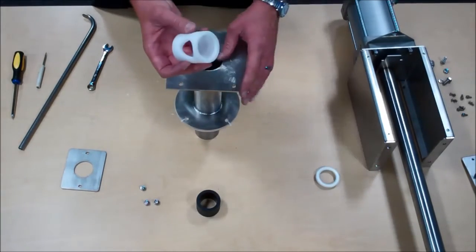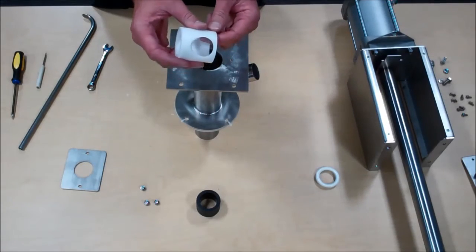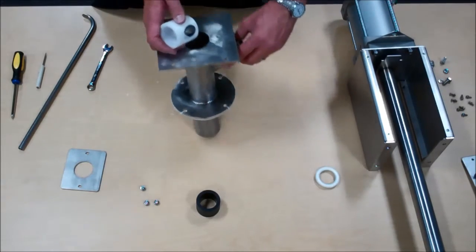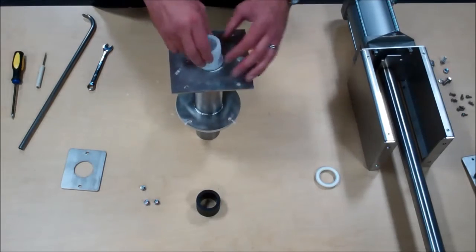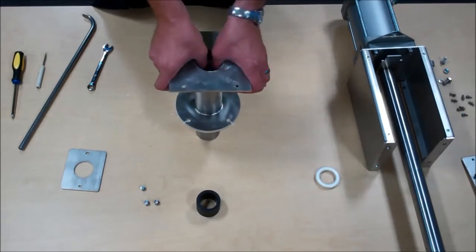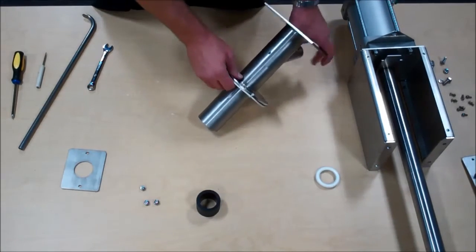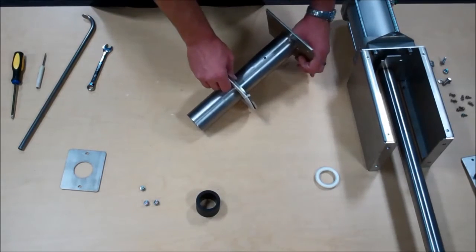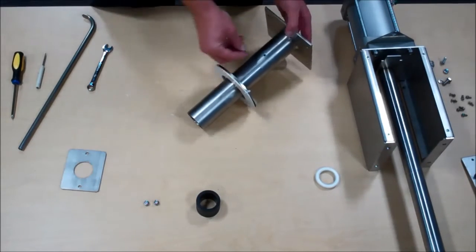Next is followed by the discharge spacer. The discharge hole is slotted at an angle, lines up with the discharge tube. You'll drop that down in to line up the slot for the retaining bolt and reinstall that.